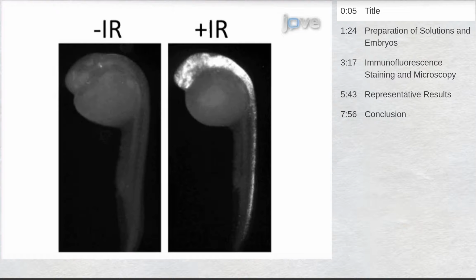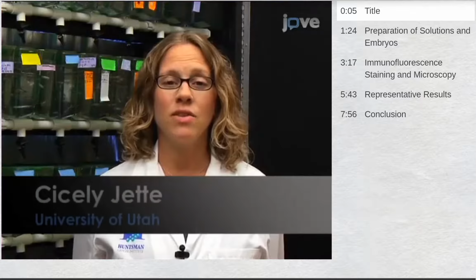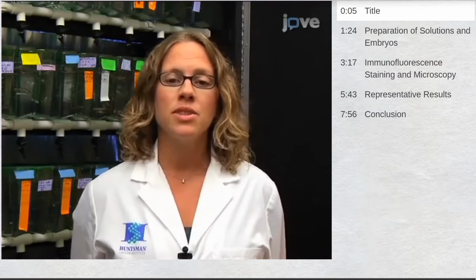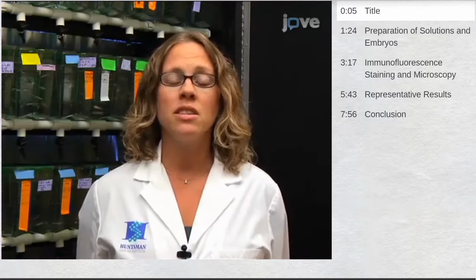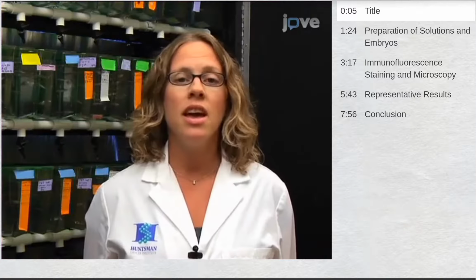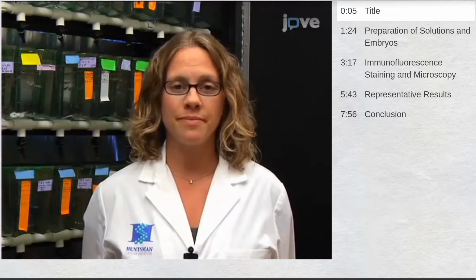mutant embryos through immunofluorescence. The main advantage of this technique over existing methods, like analysis of apoptotic cells by acridine orange staining or the TUNEL assay, is that the caspase-3 assay is a highly reproducible and relatively inexpensive method for experiments in which photographic documentation and/or quantitation of apoptotic cells is required across multiple samples.